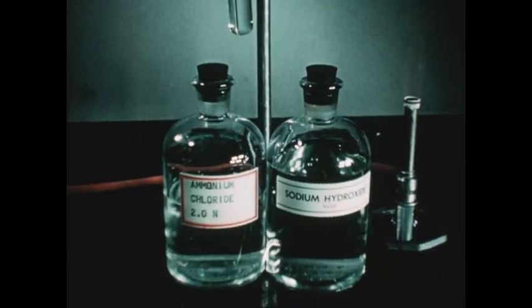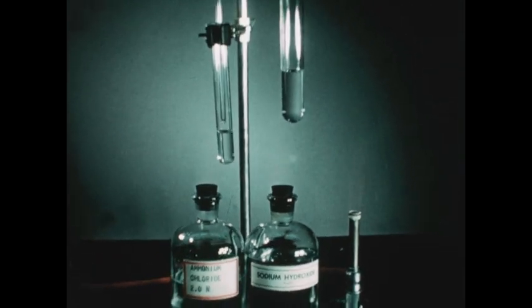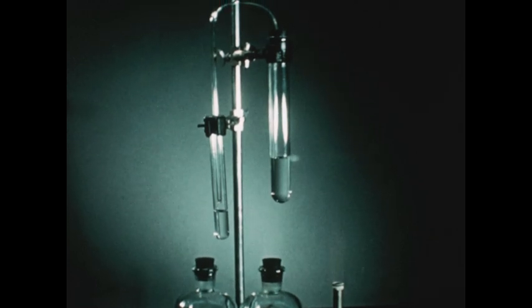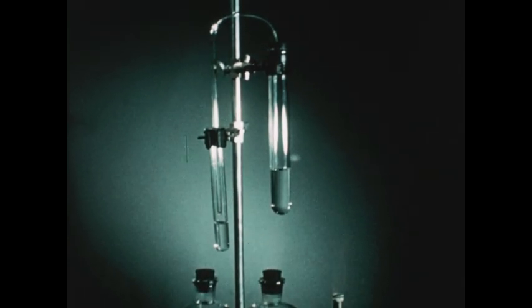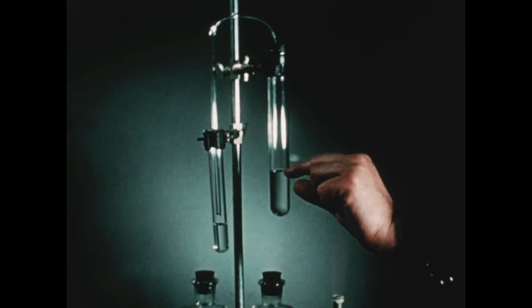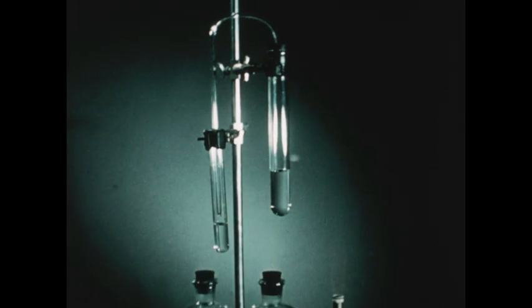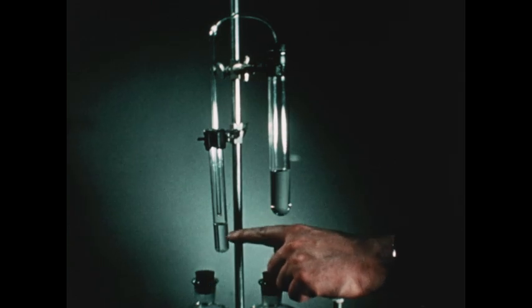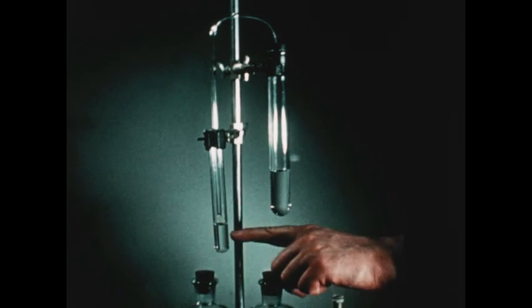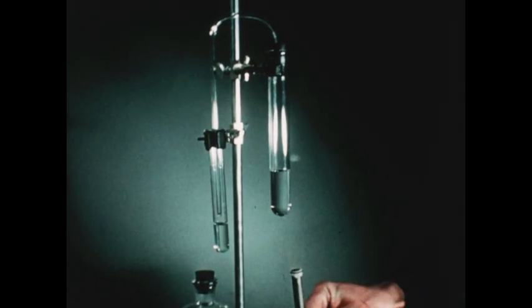Ammonia gas can be conveniently generated in the laboratory from ammonium salts or solutions of ammonium salts and strong bases such as sodium hydroxide. The hydroxide ion reacts with the ammonium ion with the production of water and NH3, which can be expelled from the solution. In this test tube, I've placed ammonium chloride solution and sodium hydroxide solution. Any evolved gas will pass through the delivery tube and down near the surface of a phenolphthalein solution, and since ammonia is soluble in water, if any ammonia is formed, it will dissolve in the solution, producing a color change. We will now heat the contents of the large test tube and observe what happens in the small test tube.